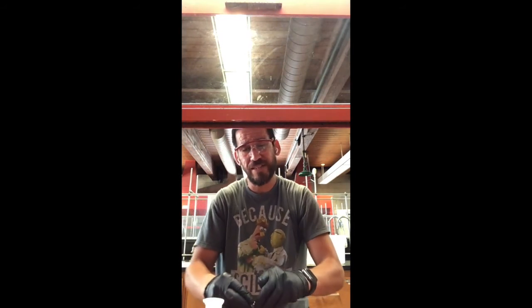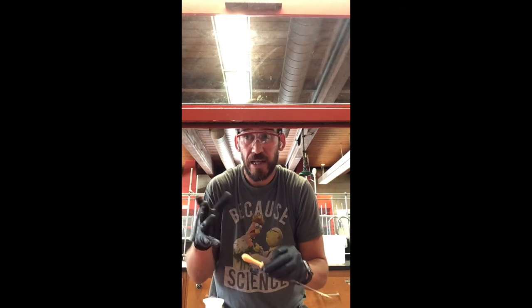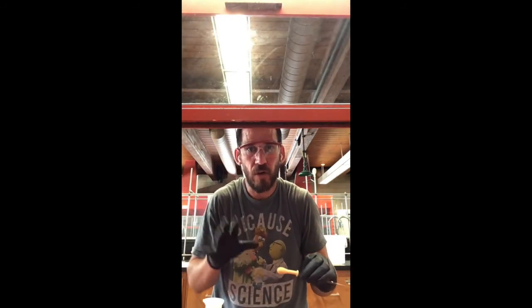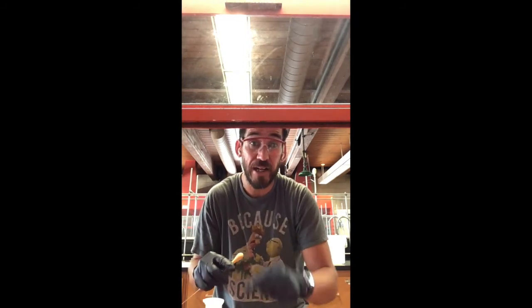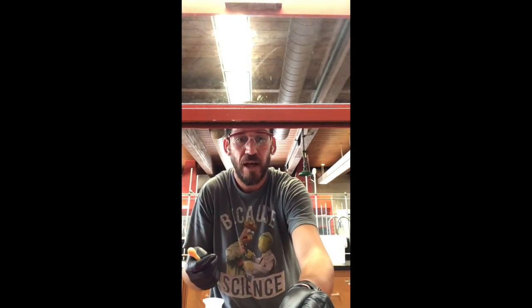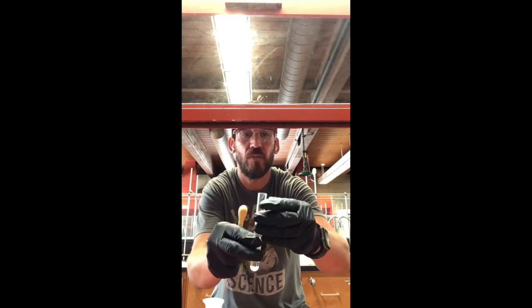And as it evaporates, because it's got a high vapor pressure, the caffeine that was dissolved inside of the methylene chloride doesn't evaporate also, so it just gets left behind as a white residue inside of that pipette tip, and so that's caffeine. So that's something to keep an eye on when you're working with things. If you start seeing a residue buildup, think about what it's from, because it might be important, it might be dangerous. There's a variety of things worth thinking about when that happens.